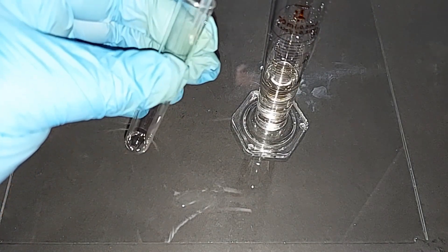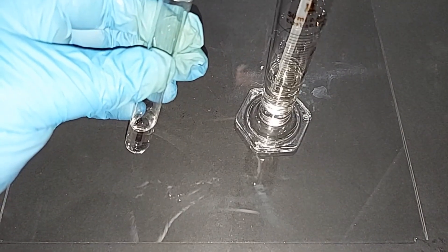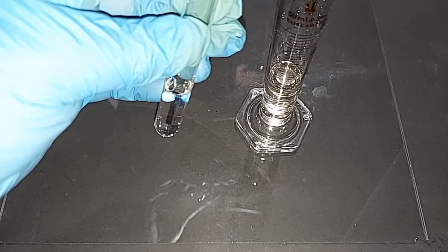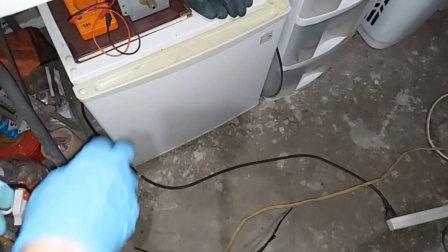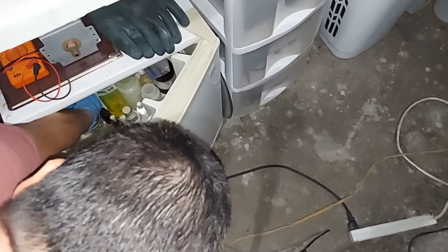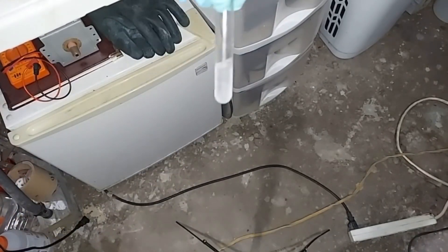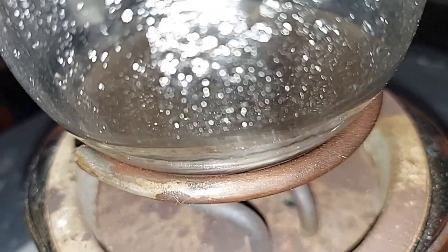Lastly, since it is glacial acetic acid, we need to actually make it glacial. It solidifies into a solid around 63°F. I put a little bit in a test tube, corked it, and placed it in the fridge. After about 20 minutes, sure enough — there it is: the glacial solid form of glacial acetic acid. The flask that held the byproduct has been cooling for a couple of hours and you can see the sodium sulfate crystals in there nicely.